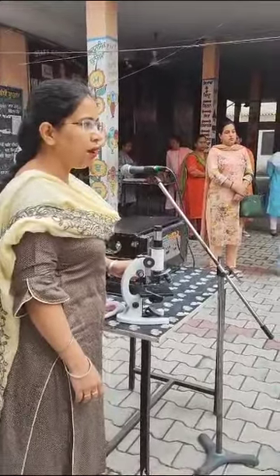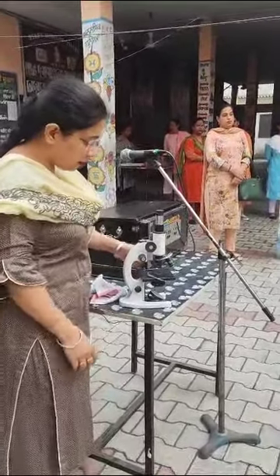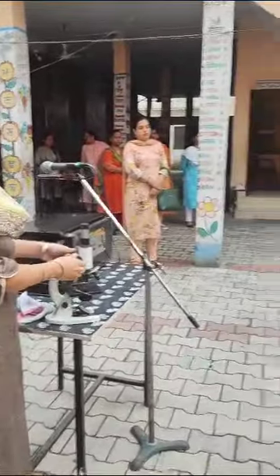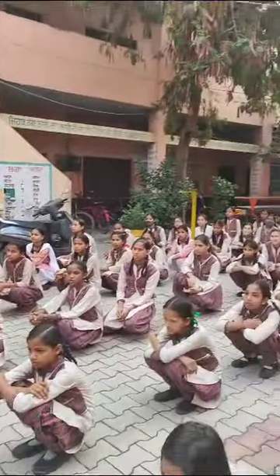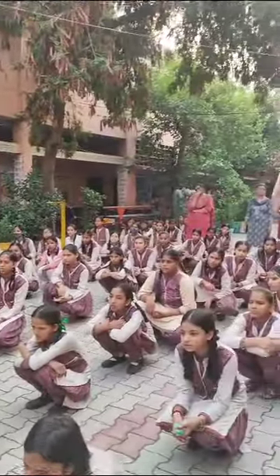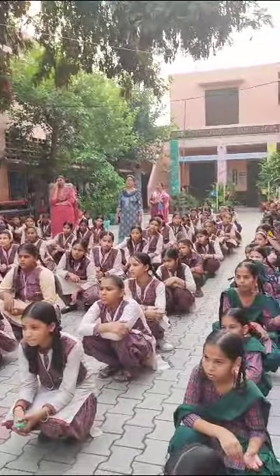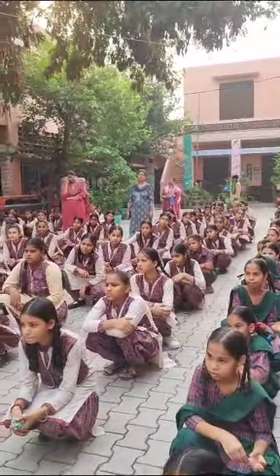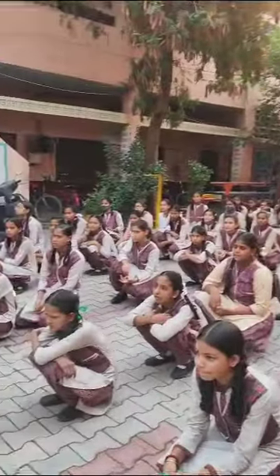The microscope we can see here is called a compound microscope. Why is it called a compound microscope? Because it has two lenses.